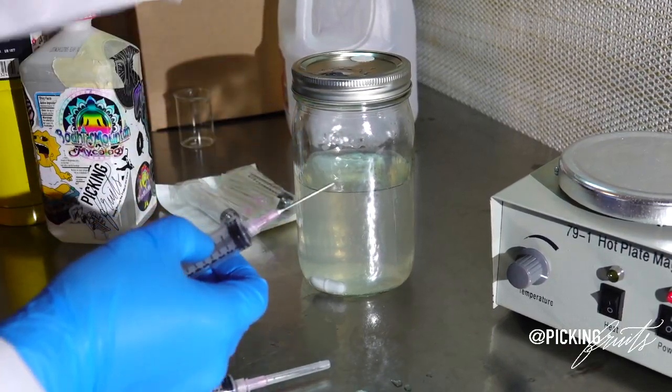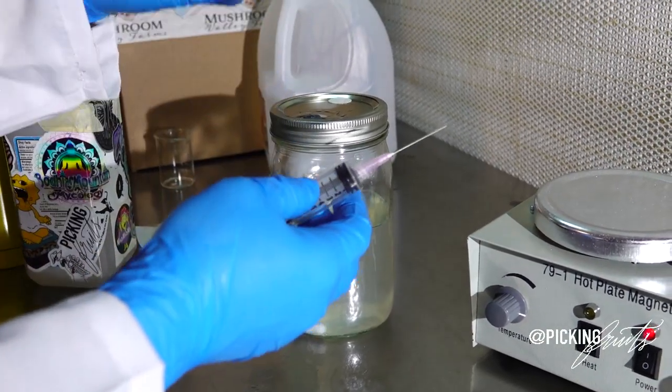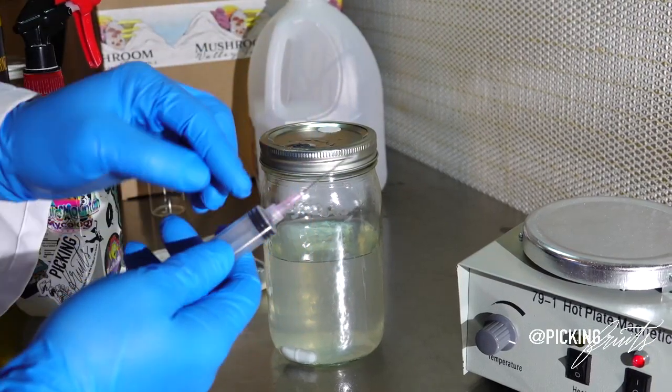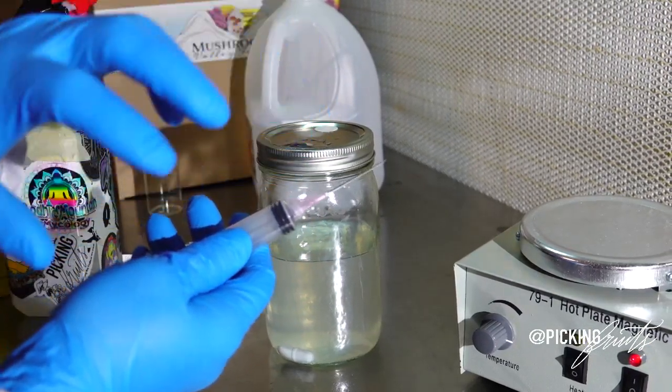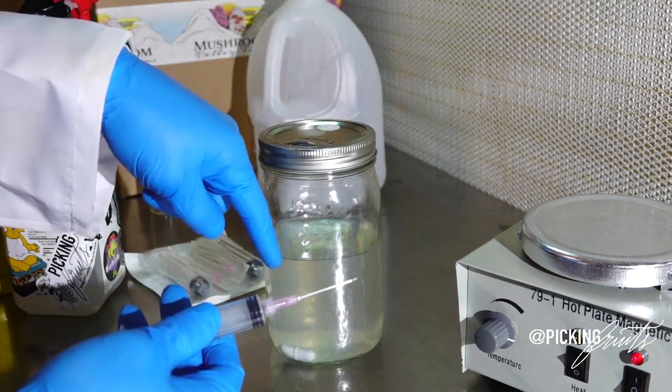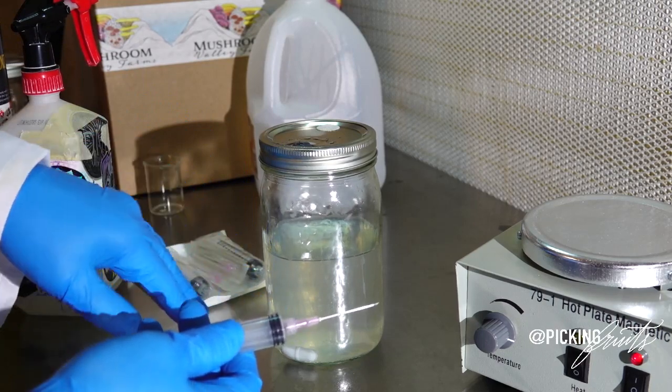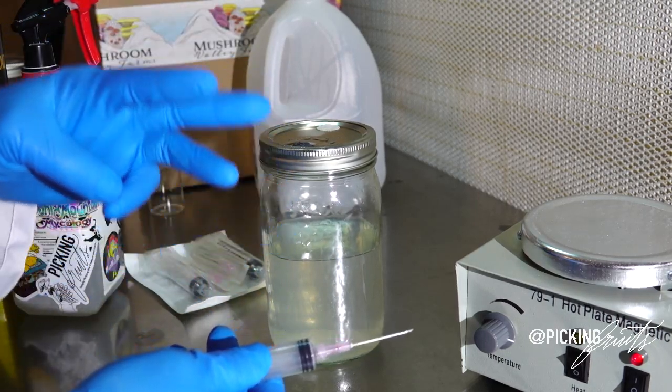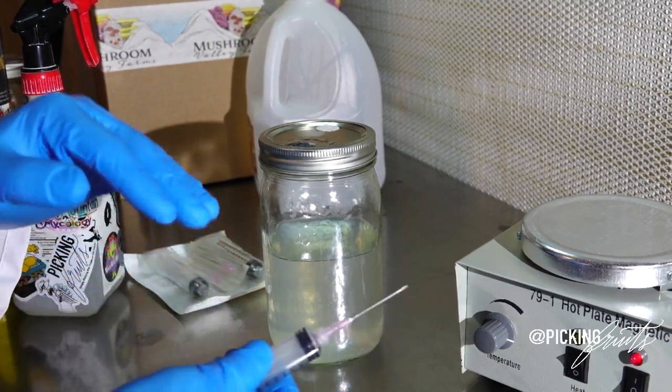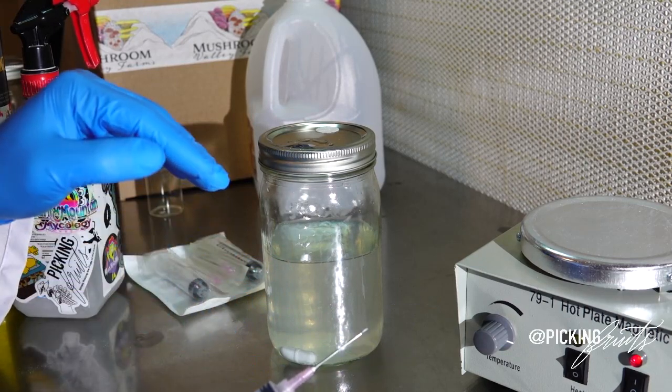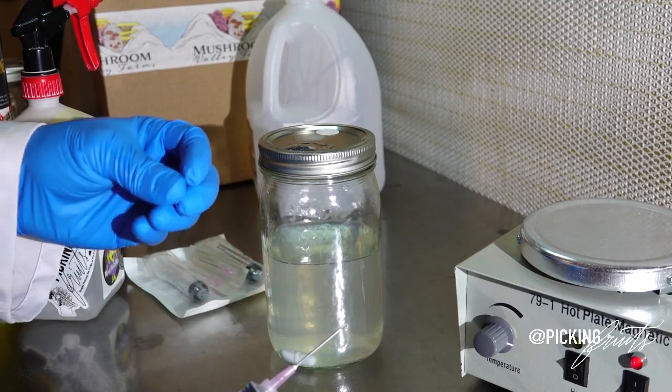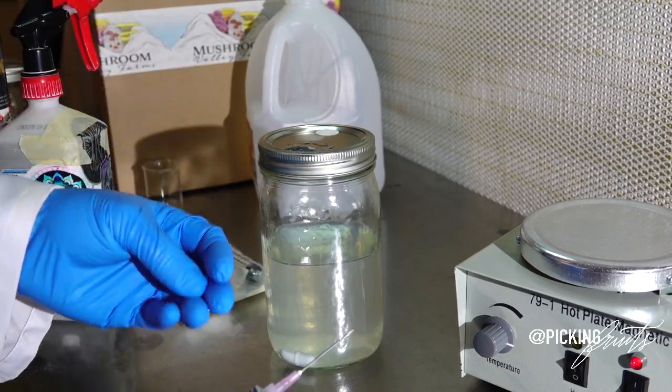You know, you're going to want to open it in a sterile environment. If you have a flow hood, make sure that you have clean hands. Make sure that the whole setup is clean. Never touching the needle because you don't ever want to introduce anything from outside into your container. If you were to get anything dirty into this vessel, there is enough nutrients in there for mold or mildew or any kind of nasty cultures that you don't want to grow inside. And they will completely devastate your growth. Your mushroom mycelium is usually not strong enough to overtake any kind of mold growth until it has actually colonized and has actually networked out.